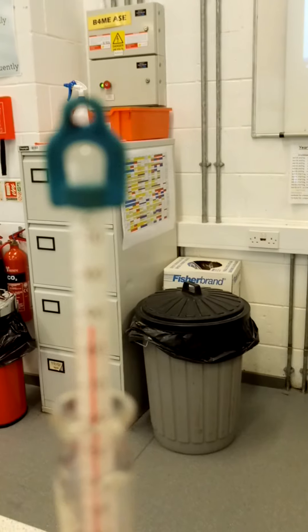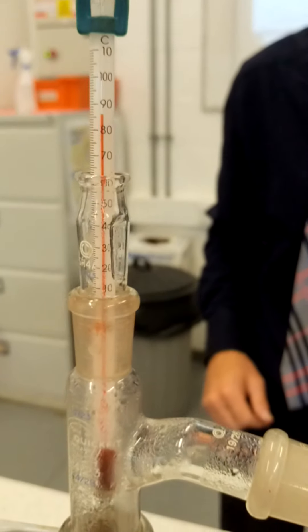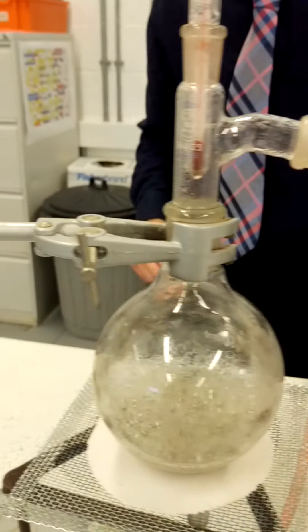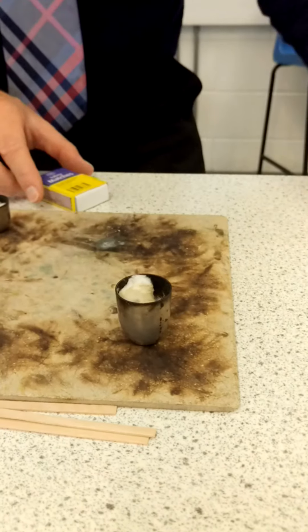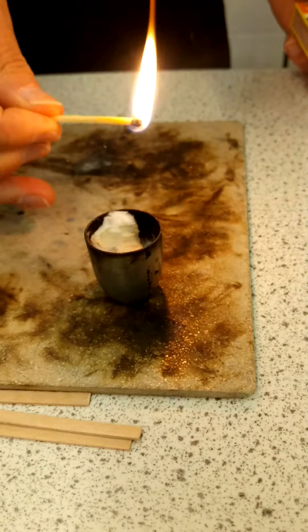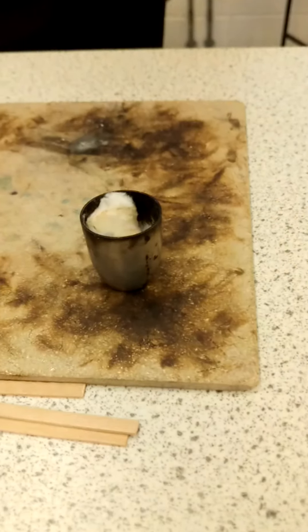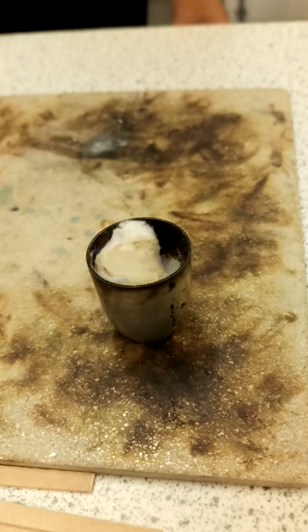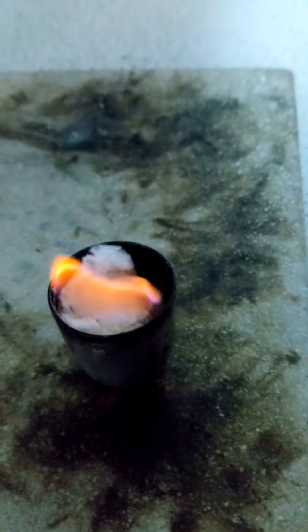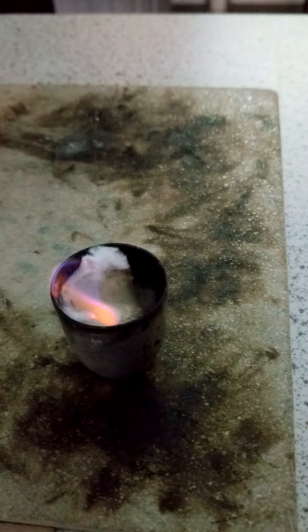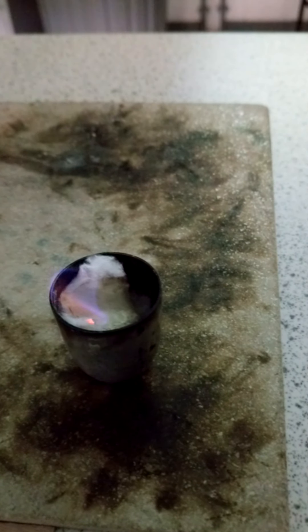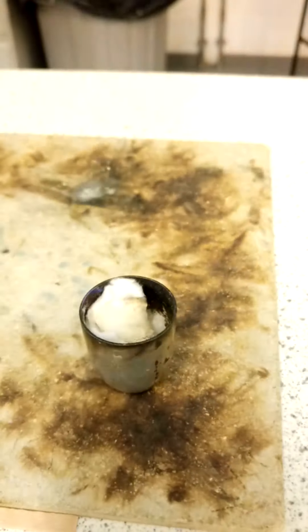So I'm now going to try and find out what this is. I'm going to take the distillate and I'm going to pour it back into the mineral wool here. And let's find out whether that will ignite. There we go. Hopefully you can see that that ignites fairly easily. Turn the light off. There we go, that's better. You can definitely see that now. So clearly that is the ethanol that was in the mixture at the beginning. It is not water, it's ethanol. And I guess what we've just proven there then is that we have been able to separate the water from the ethanol.